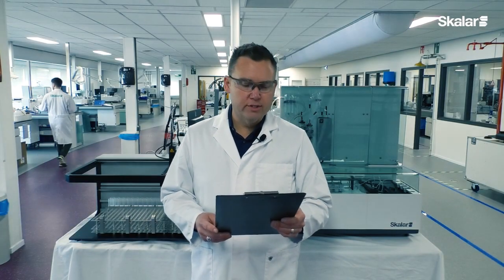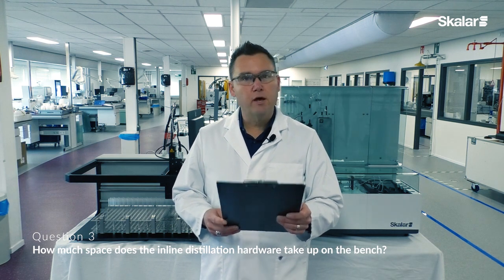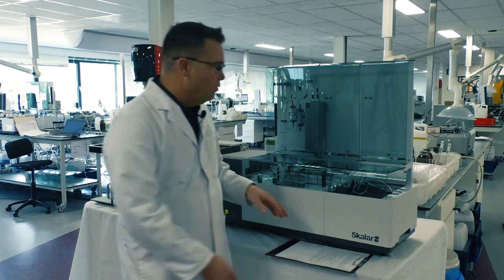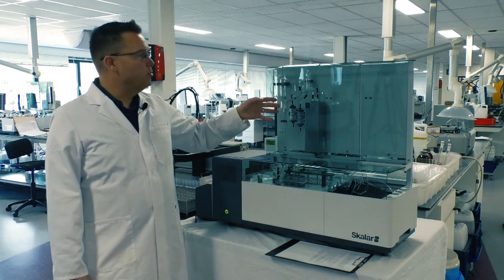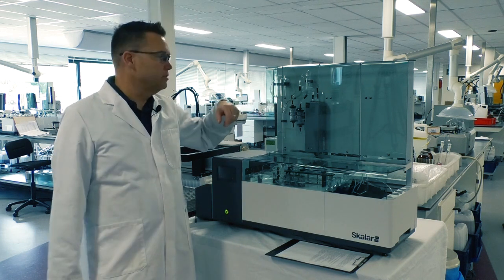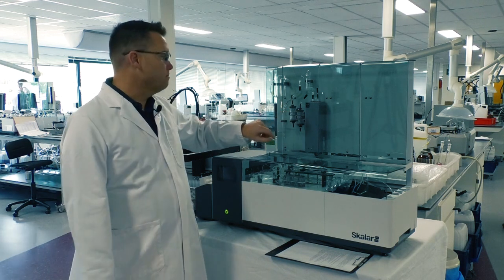So on to our third question. How much space does the inline distillation hardware take up on the bench? So for that question, we go to our instrument. This is an example, this is an ISO form of total cyanide with inline distillation. And as you can see, all of our distillation is done here above board.